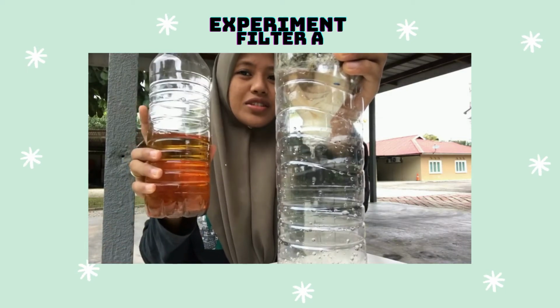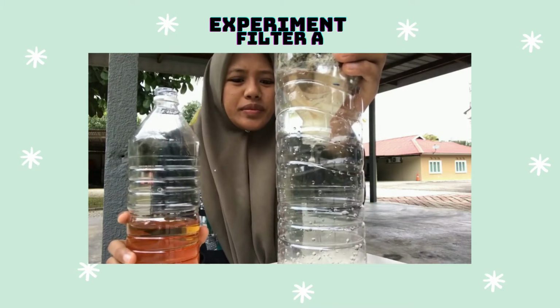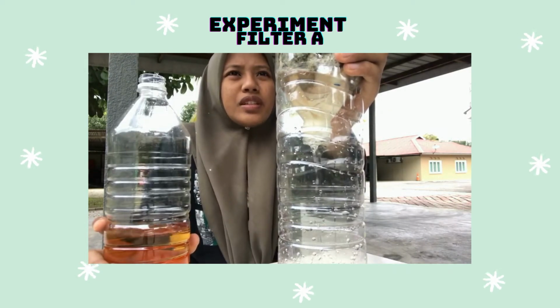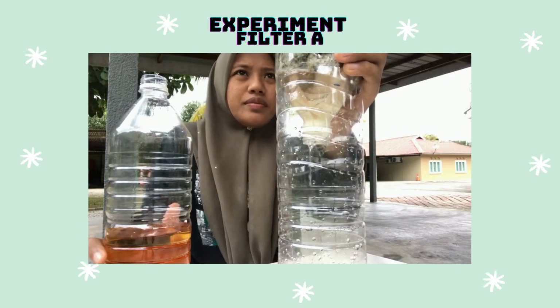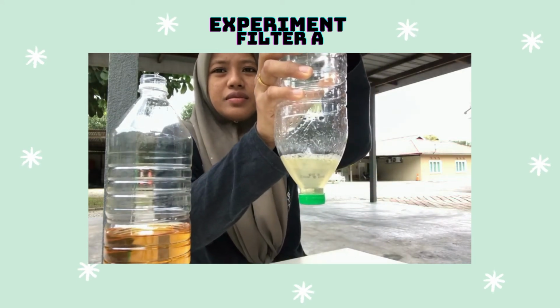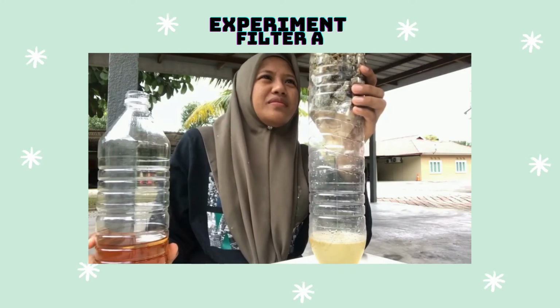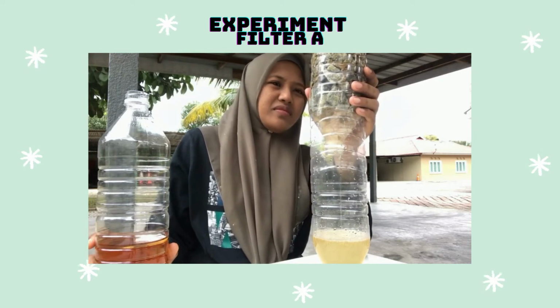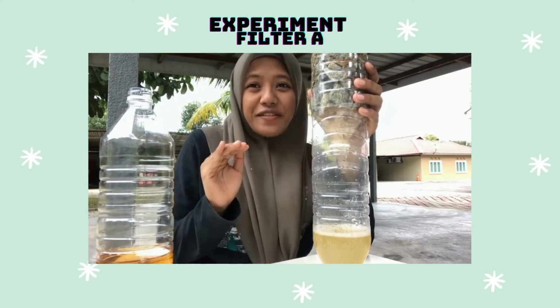Okay, this is the original color. Then we will see the result of the color. The smell is so good. It's not really strong, the smell. You see, this is the color. The water is dropping very, very slowly.